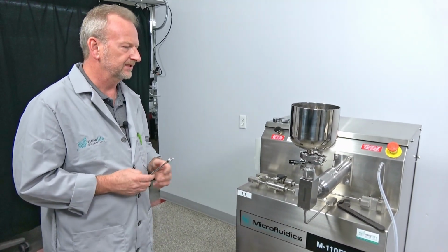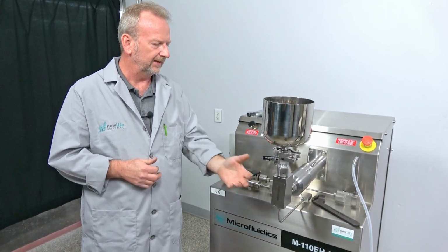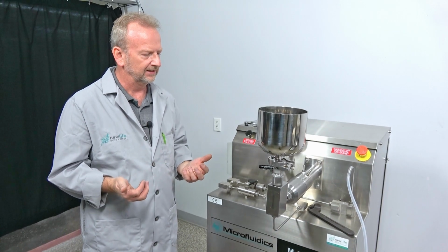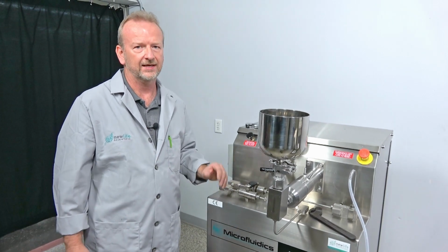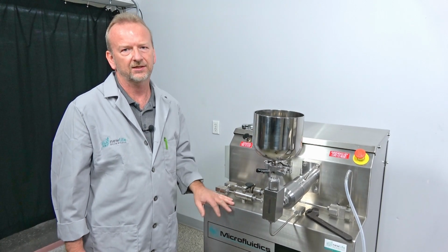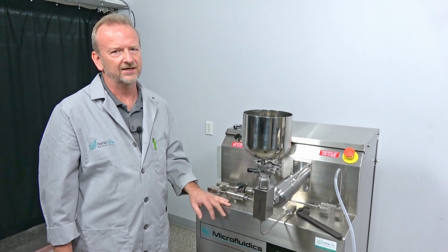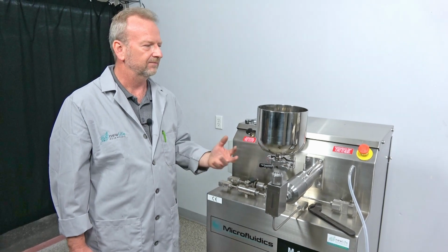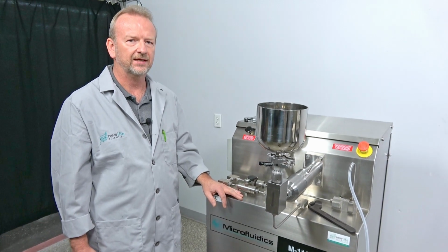So super simple. If you've got any questions, or if you want to go deeper and rebuild the check valve in it and you feel confident about it, just get a hold of me. We might shoot a video on how to do that too. But the big one is definitely knowing how to replace the plunger seal, because you don't want to call a service technician out to do that. If you're running production, this ought to be something that you have available and keep in stock, especially if you have an in-house technician that can just come in and do that for you. That's how simple it is. It keeps you up in production. Once you get it down, you should be able to have this changed within 15-20 minutes.